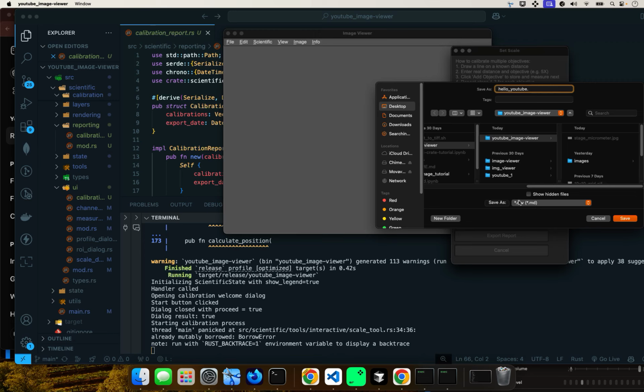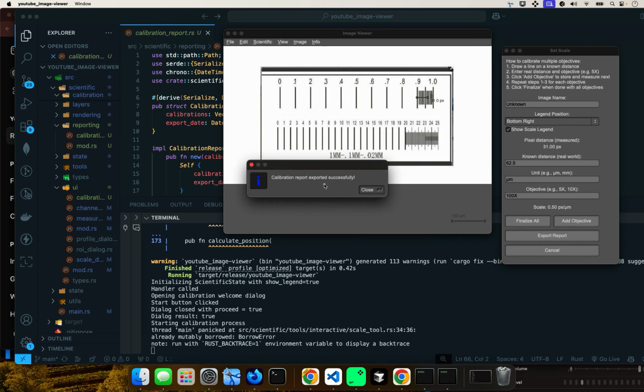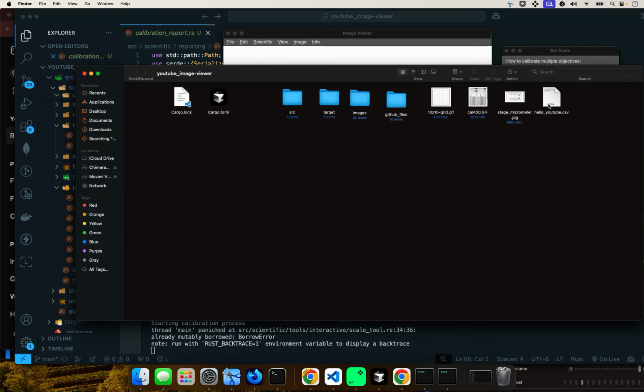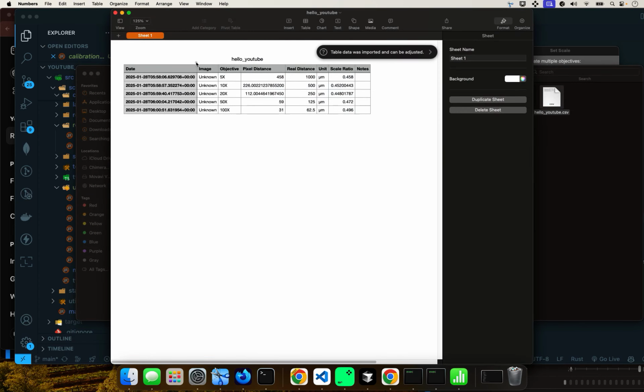You can do anything right there by just changing it and adding to the Cargo.toml file. But I just keep it simple. We'll go with CSV, comma separated value. So let's go with CSV. Then go save. Calibration report was exported successfully. And now you can find it, and it's right there. Now you open it, and there it is.